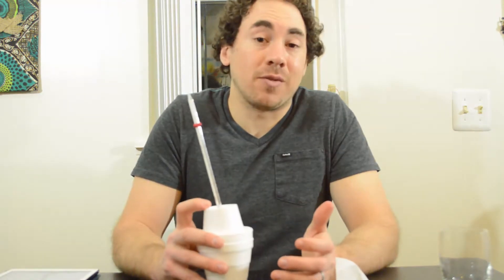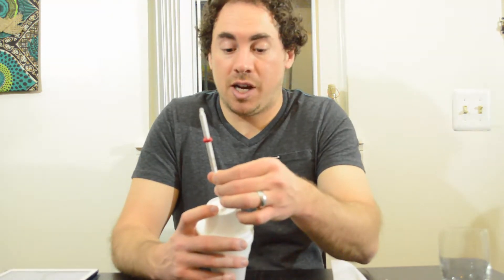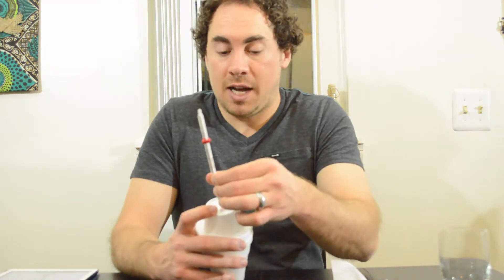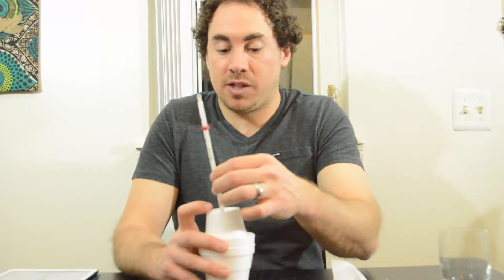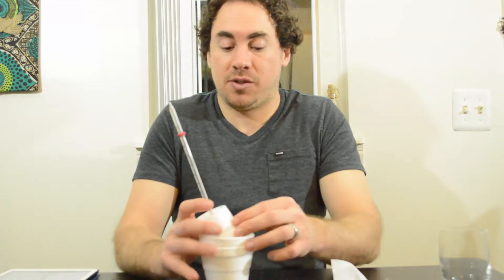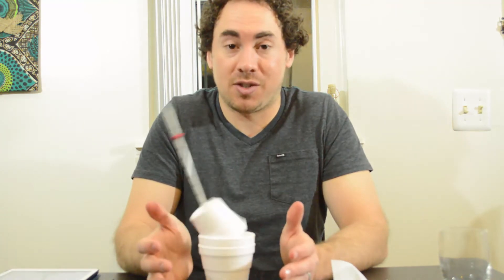After about a minute of stirring, the initial temperature of the water was 21.5 degrees Celsius. After adding and dissolving the calcium chloride, the temperature has risen to 26 degrees Celsius. So we can now do the math and find out how much heat was released during this chemical reaction.